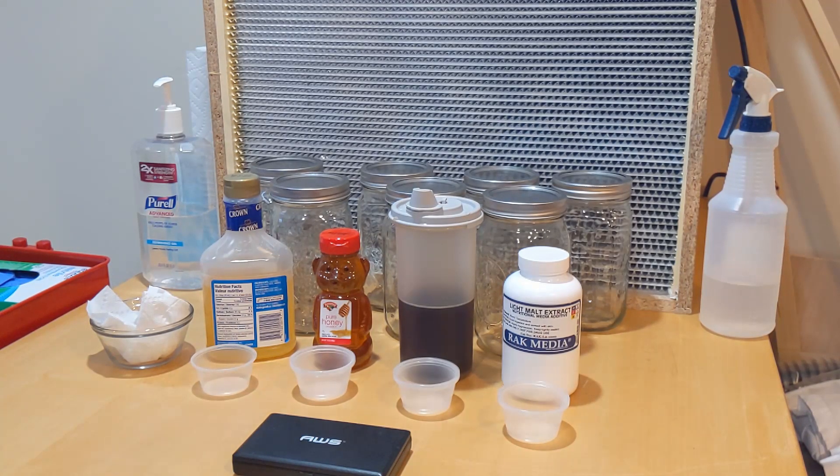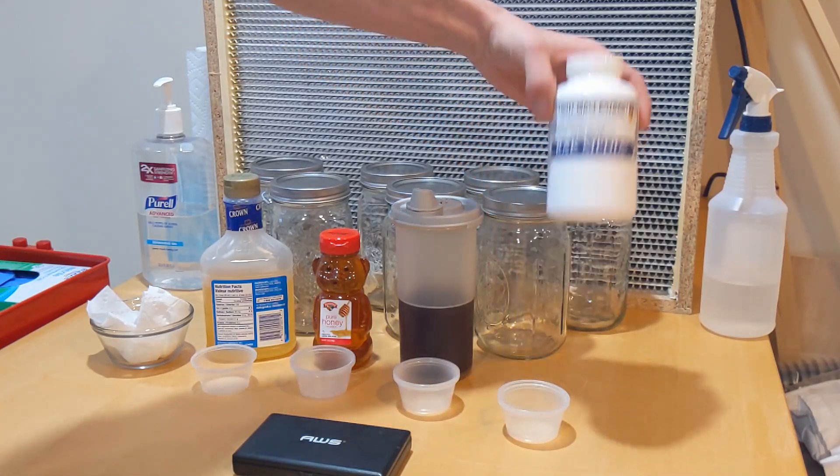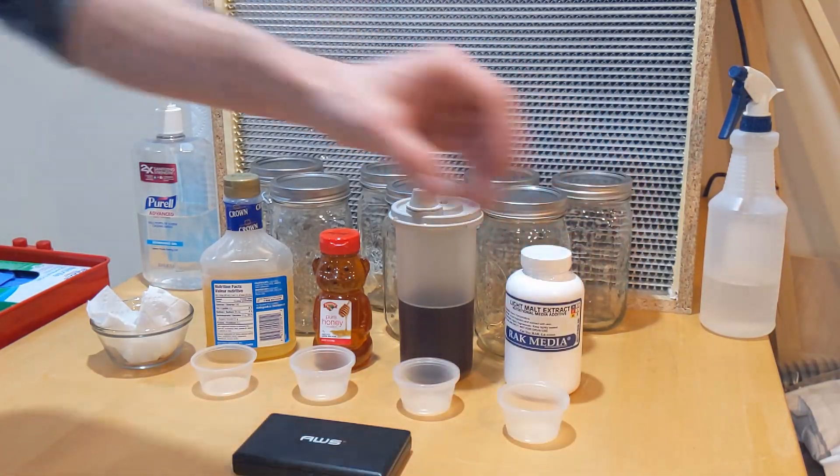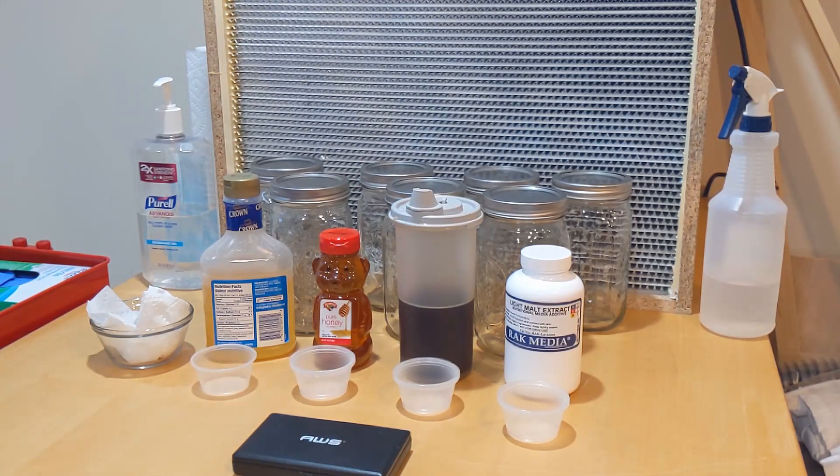My favorite would be to use light malt extract. Now, what a liquid culture is, is pretty much just a sugary solution that the spores or mycelium can feed on and then grow.